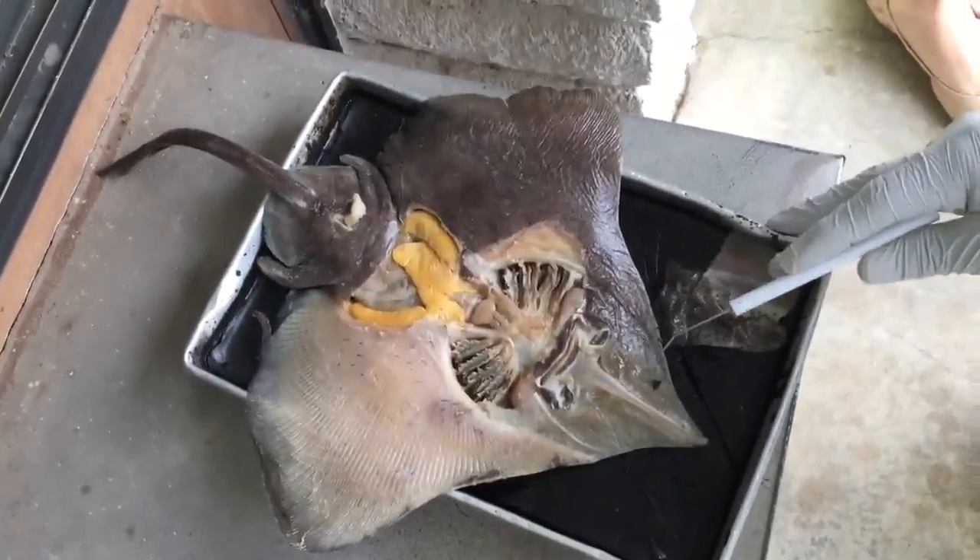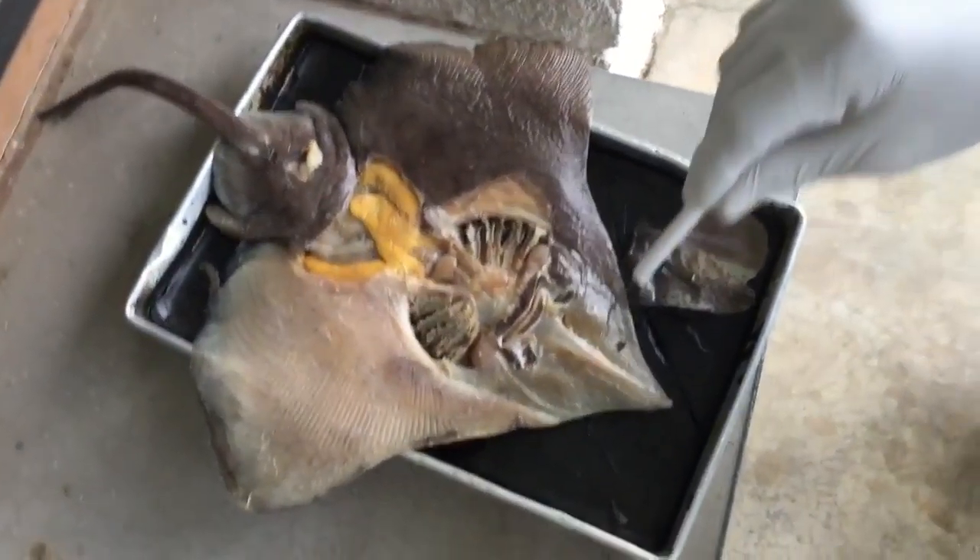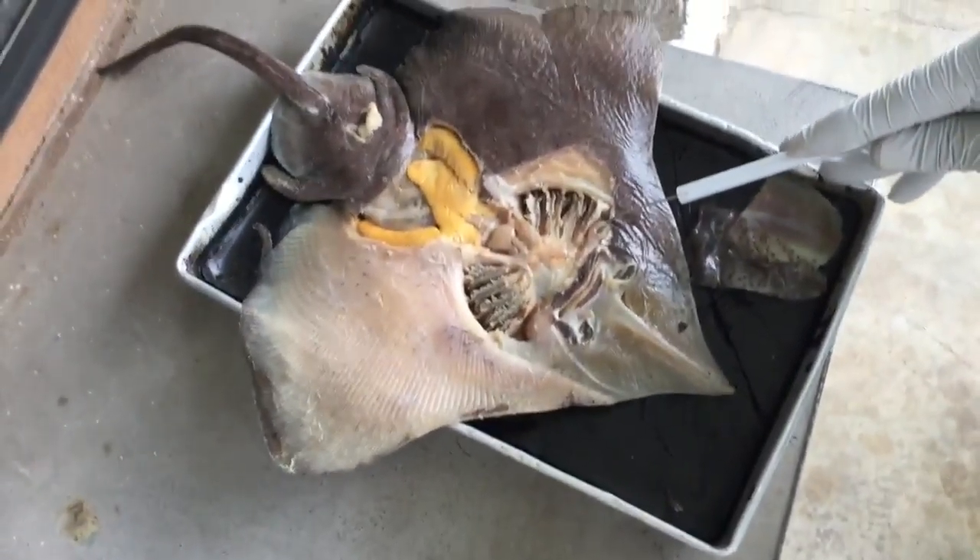We open them right open. Alright, we'll start off with the snout, the nostrils, the mouth, the mouth muscles.